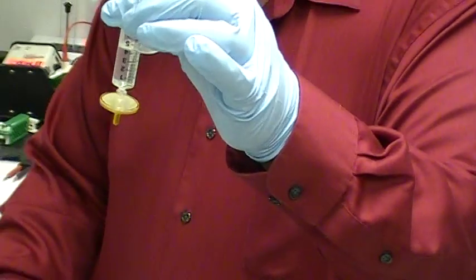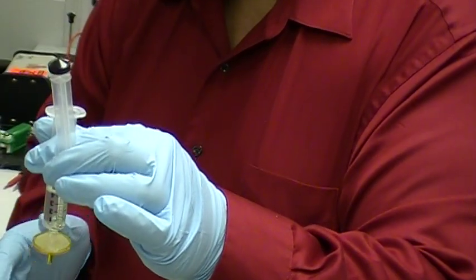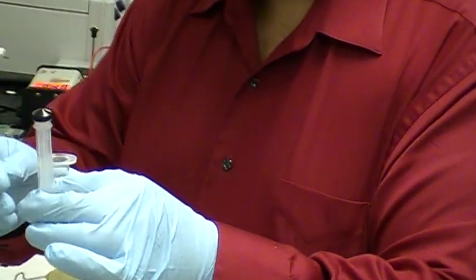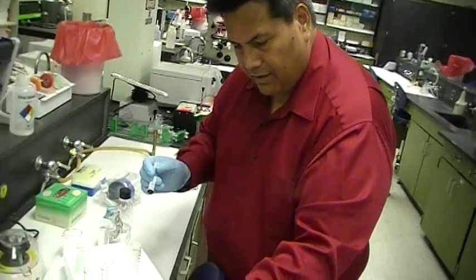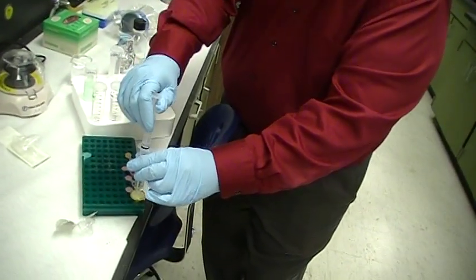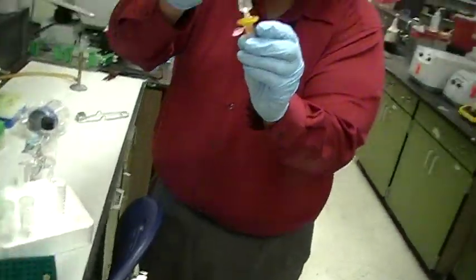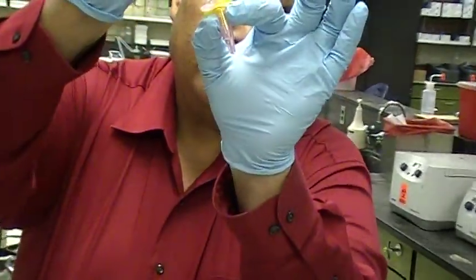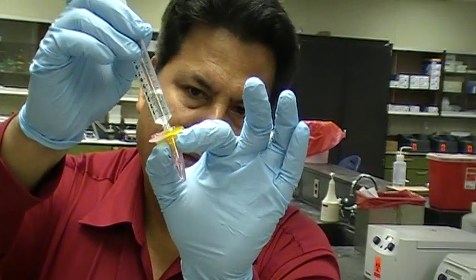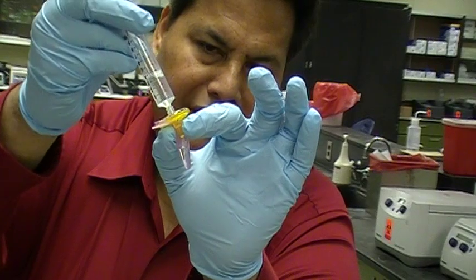And let's say I want to filter this into smaller tubes for aliquot purposes, so that I can freeze the aliquots in the freezer. You simply take this, put it over the microcentrifuge tubes, like that, and pick this up so you can see, and you move the plunger down. As you move it, liquid is coming out, filtered and sterilized on the other end.